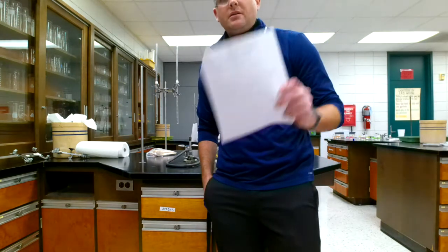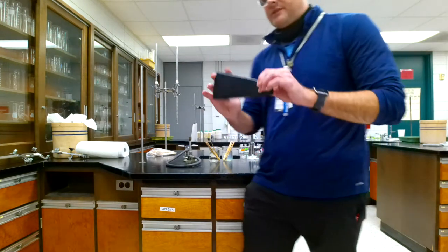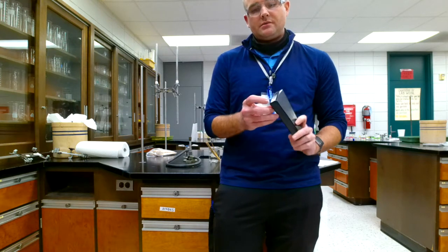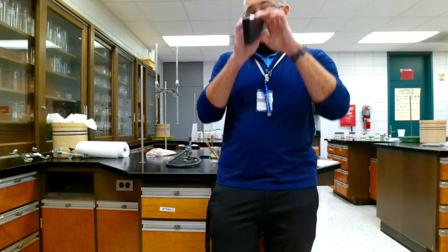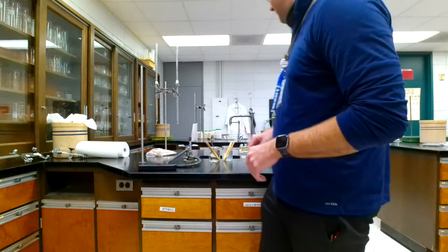So then you have to do the analysis conclusion part. Few questions. Now, the first part says to describe the appearance of the overhead lights observed normally with your eye or with the spectroscope. I think I left that question off on Schoology because normally you are able to observe these through what we call a spectroscope right here. This is essentially a prism where the light goes through this hole right here, and some background light comes through here, and then you observe through here. And you should be able to see the spectral lines through this spectroscope. So it's a little handy tool.